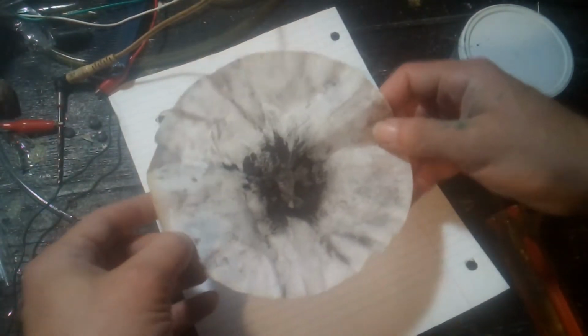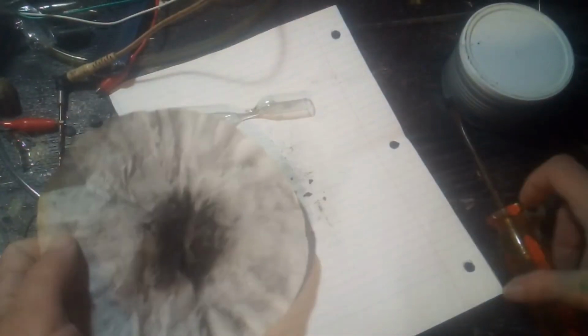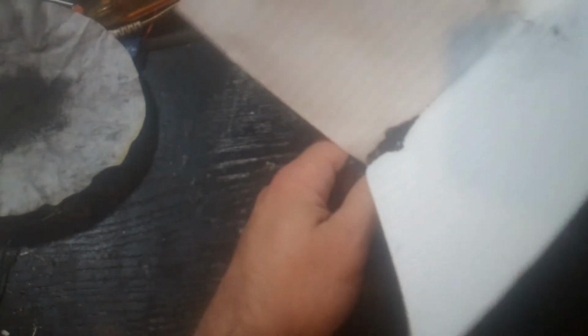That doesn't look like a very impressive sample to me. So I'm gonna grab the boron from the first test run, and I'm gonna add that. Well, it's a little better looking sample, I think. At least takes up more space. I don't think boron is going to glow any interesting colors with high voltage and vacuum. But I don't know for sure, so I might as well give it a try, right?